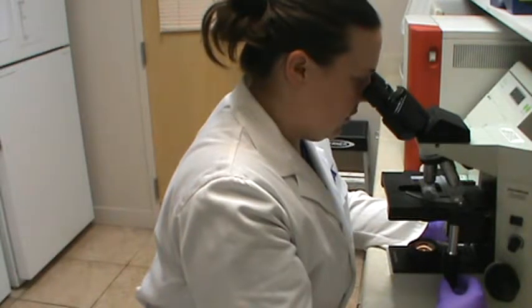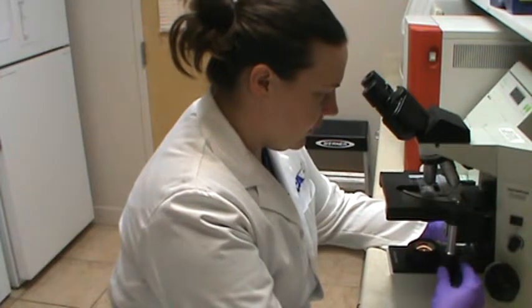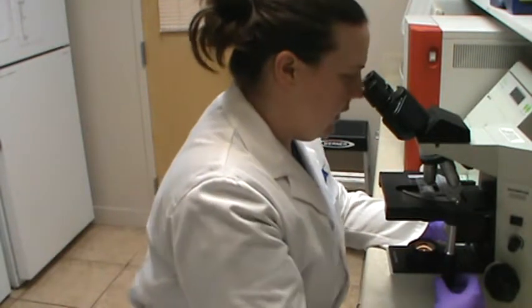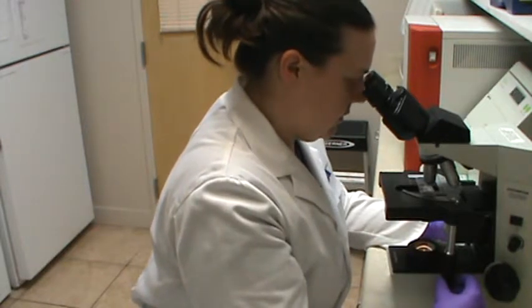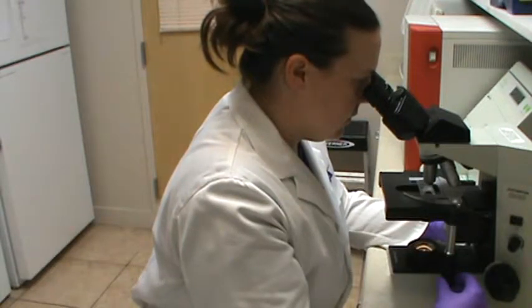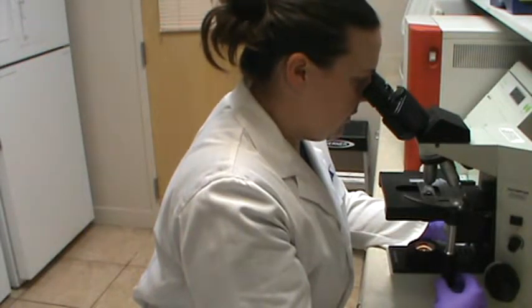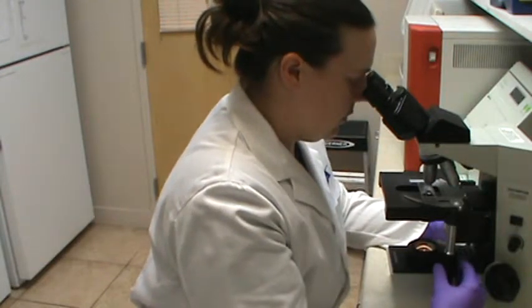And just normal epithelial cells. And then my cover slip, so we're going to go up and we're going to go from right to left. Again, not seeing too much of anything other than just some normal skin cells, couple red blood cells.